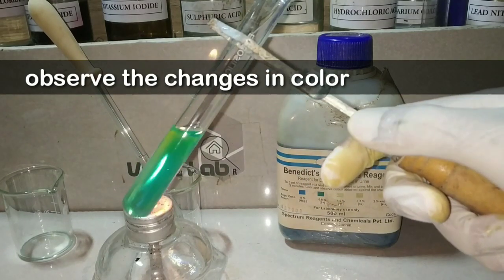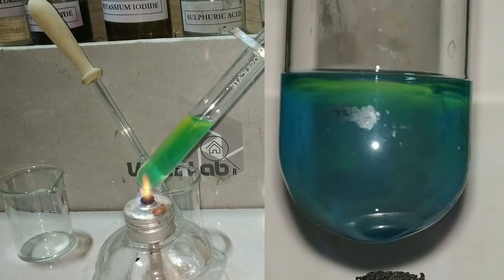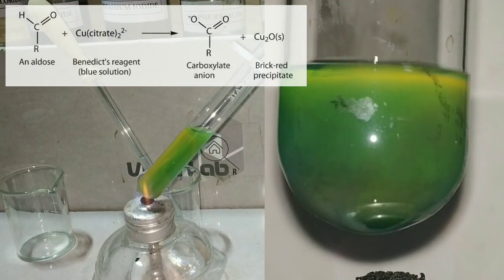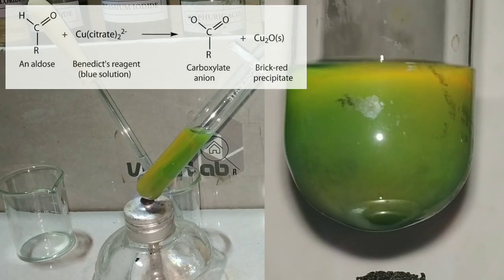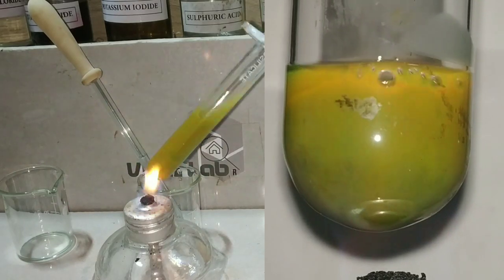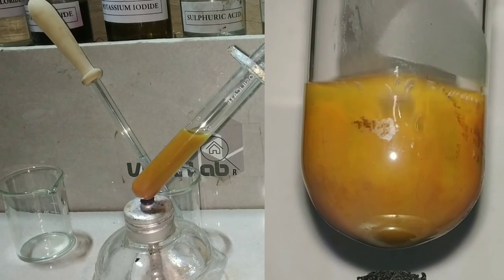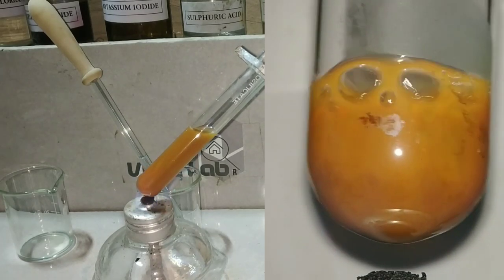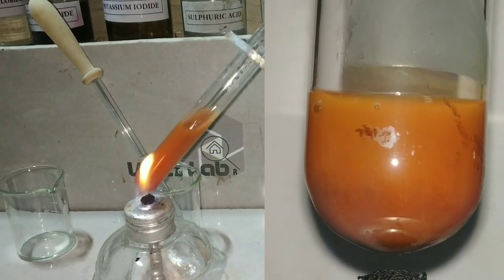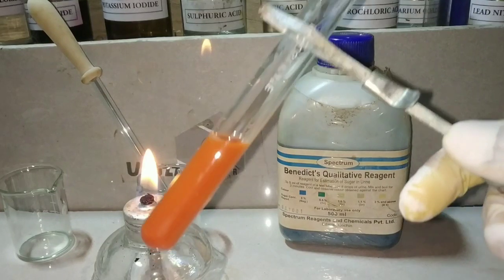You can see that when the solution has started to boil a little, there is a color change. Initially you see a green color, and then you can see a yellow precipitate forming on the top. Slowly that yellow color changes into an orange color, and finally you get the brick red color. In the Benedict's test, the brick red color is the color obtained with the maximum concentration of reducing sugar.